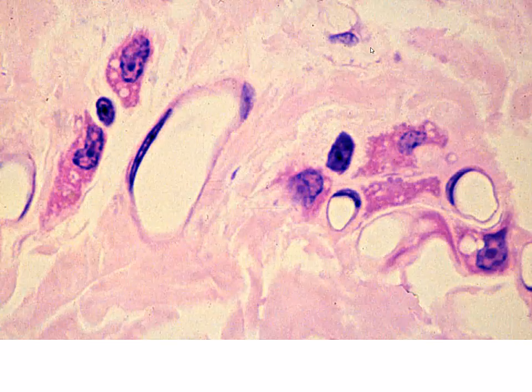Now we're going to be looking at cells again. We are in a field, and it's difficult to tell at this high of a magnification if we're looking in loose or if we're dense irregular. There are quite a few fibers in here, so my gut reaction is we're going to go with dense irregular. So we're like in lamina propria as we saw in the previous image. I don't exactly know where we're looking.